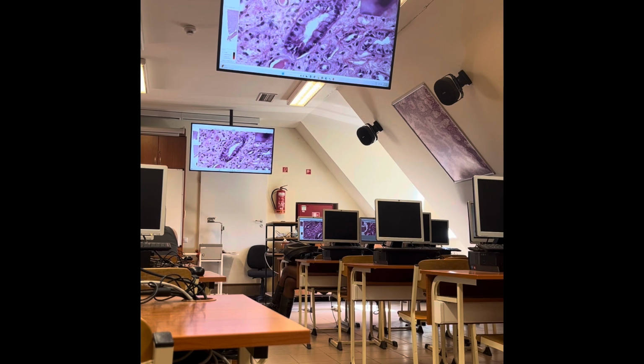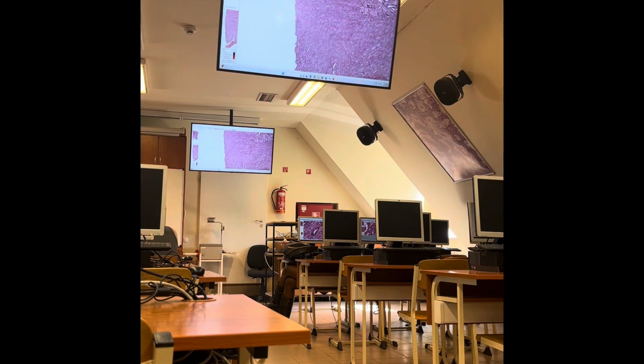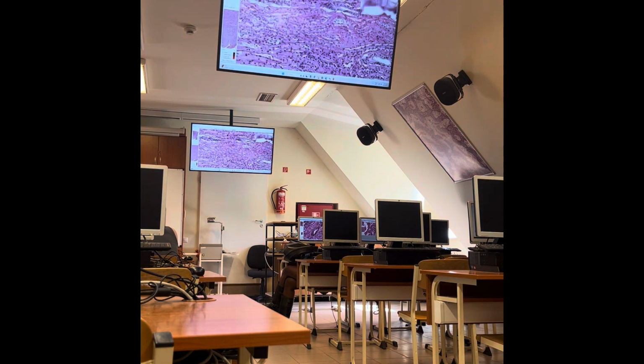Can you talk a bit about the dark and light cells in the collecting duct? Aren't those physiological modifications? No, I cannot show you these, they are not visible with the HE staining. I cannot tell you about that.